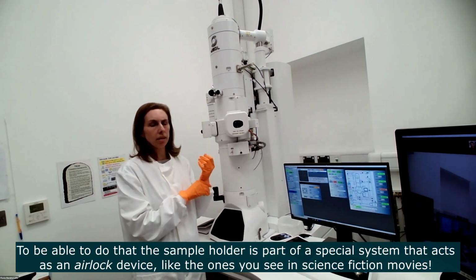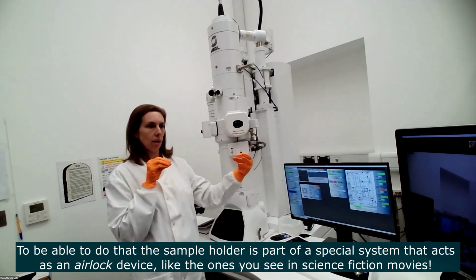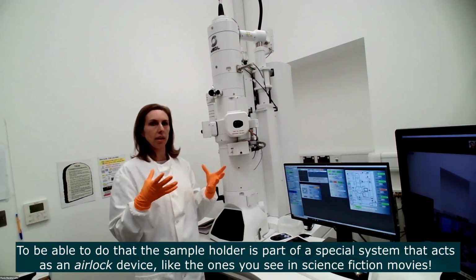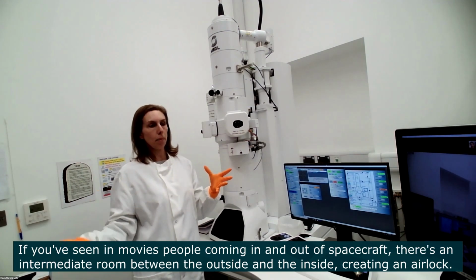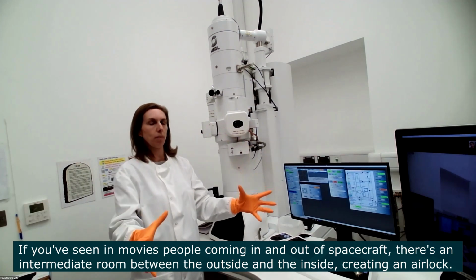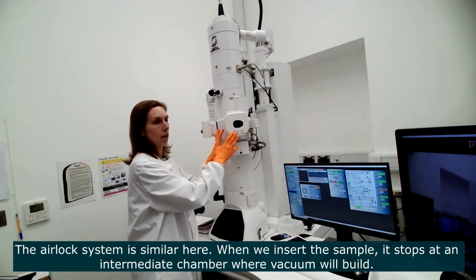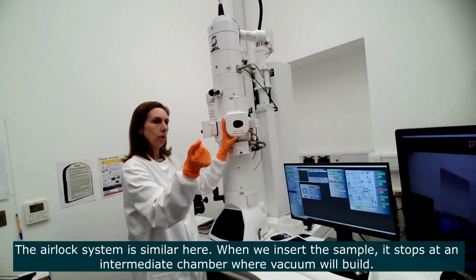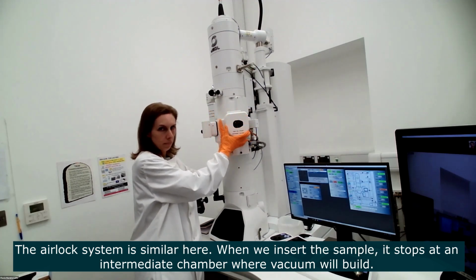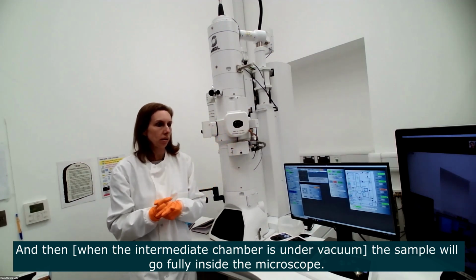To be able to do that, we have the holder that we use for inserting the sample. It's a special device, a little bit like an airlock. If you've seen science fiction films, people coming in and out of spacecraft go through an airlock system, a special room that builds up pressure. This is similar. When we insert the sample, it goes to an intermediate chamber where vacuum will build, and then the sample will go inside the microscope. So it's a special airlock system.